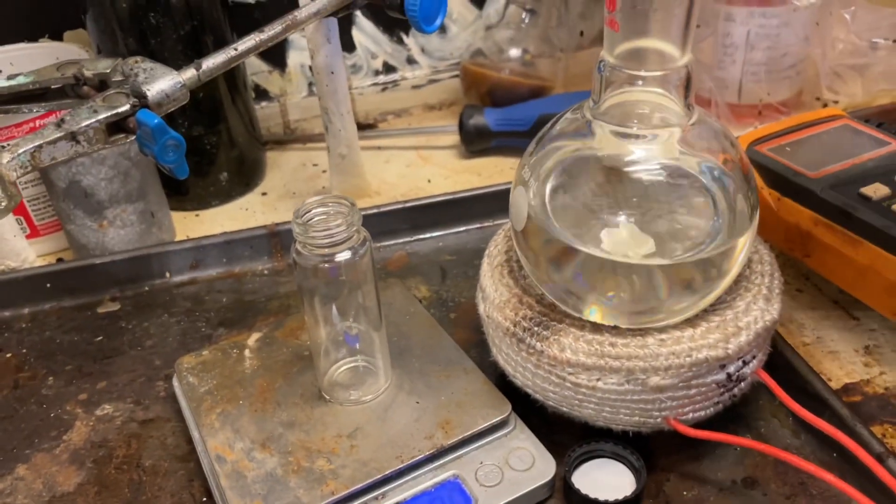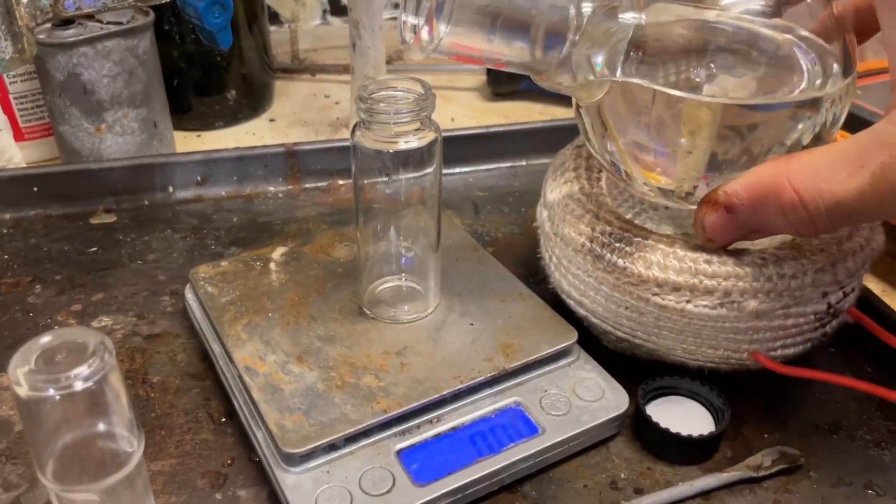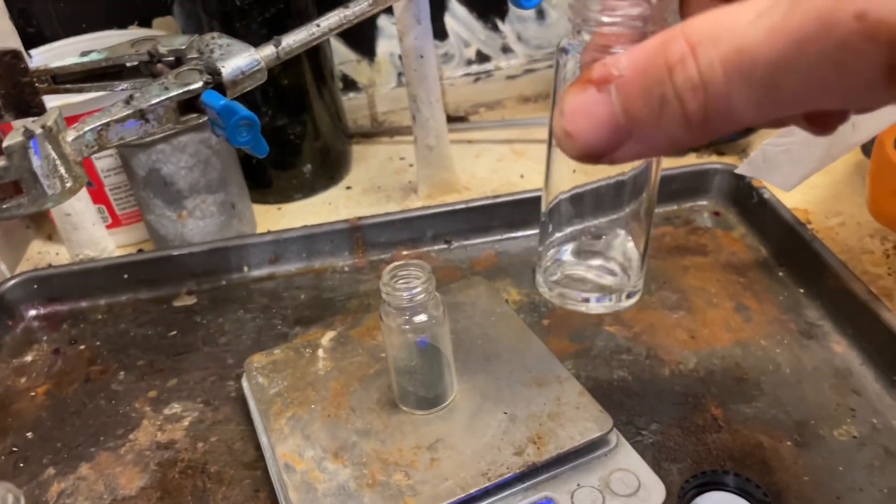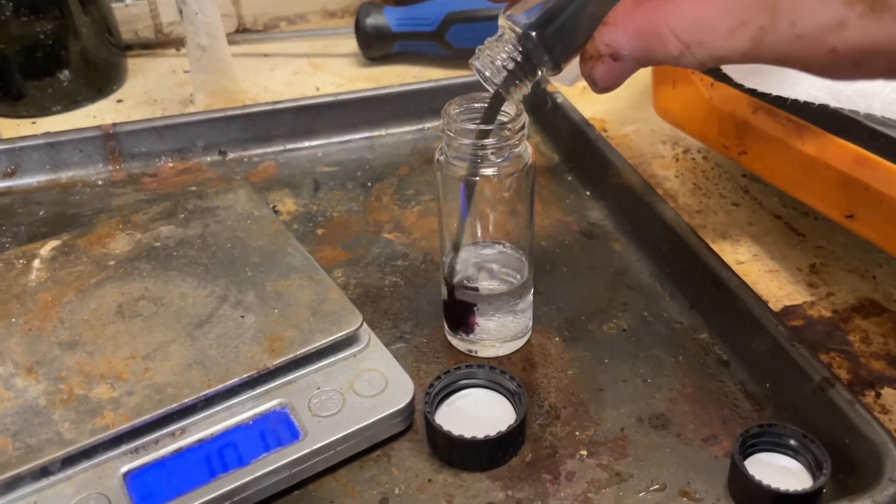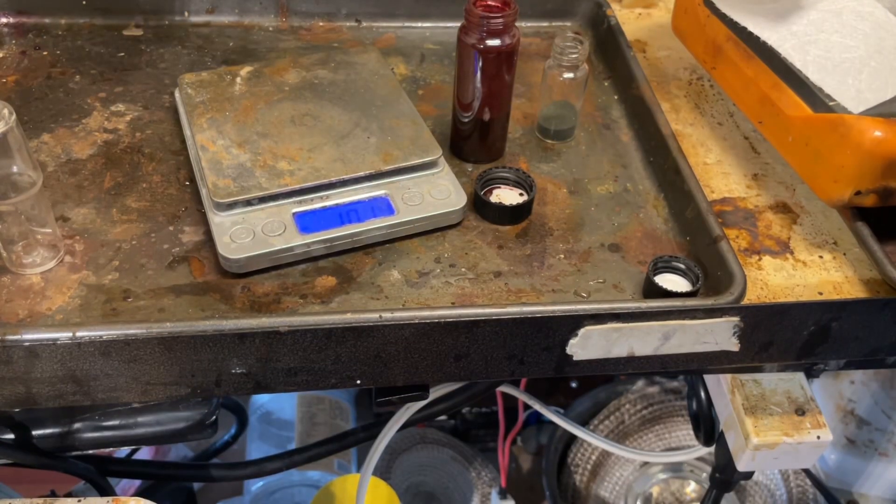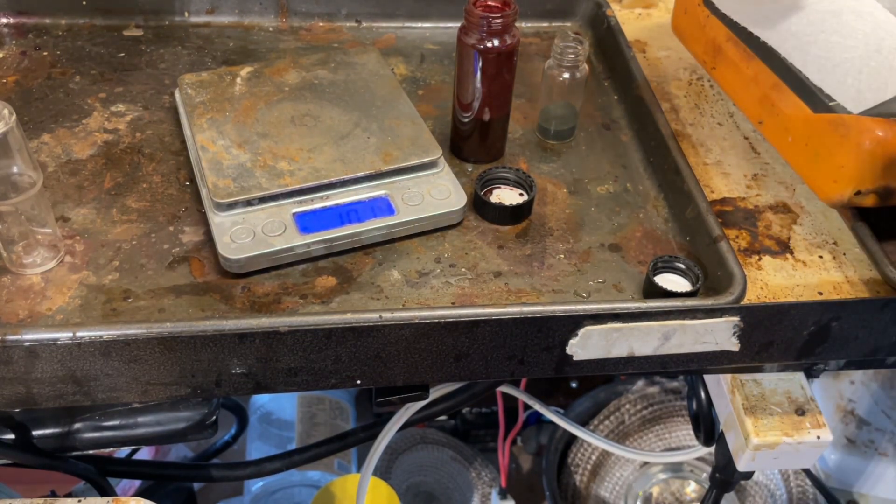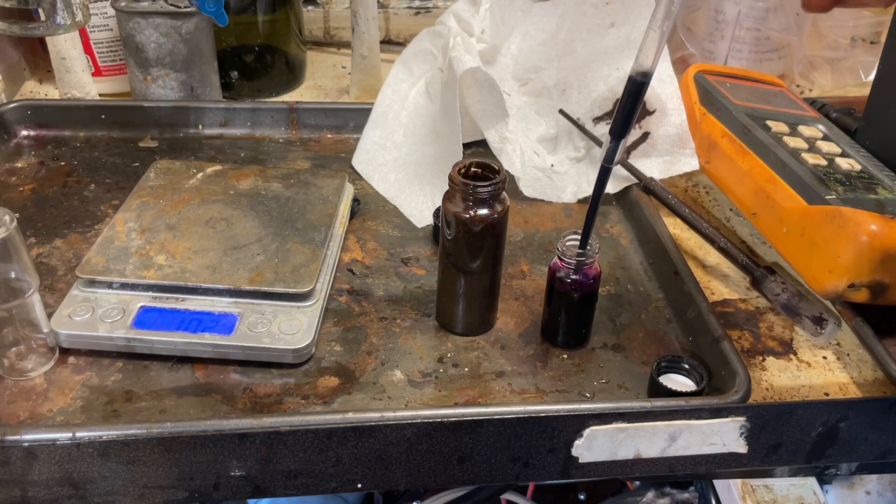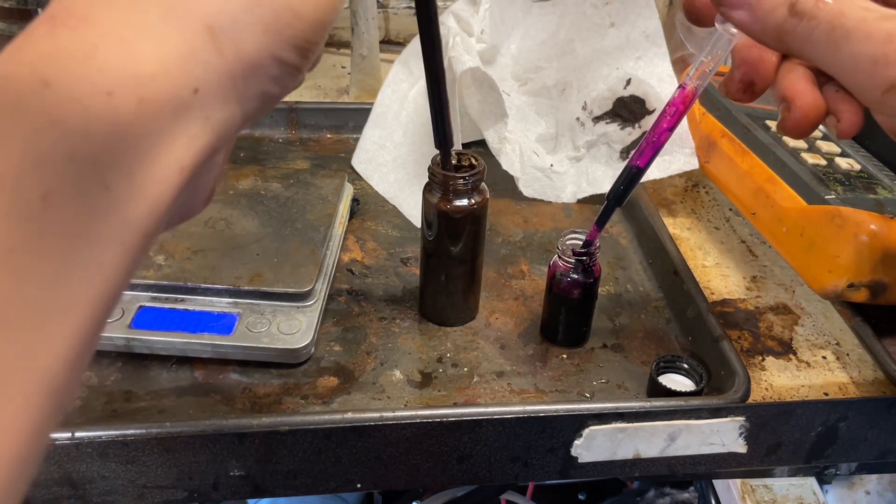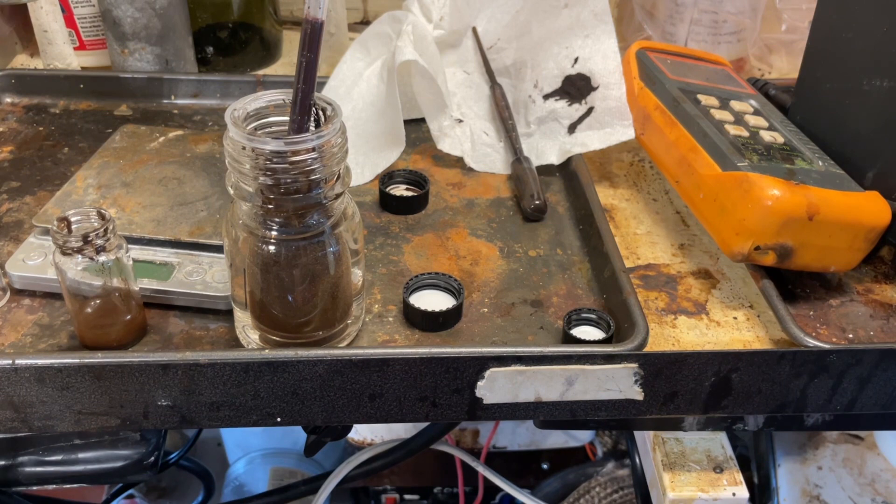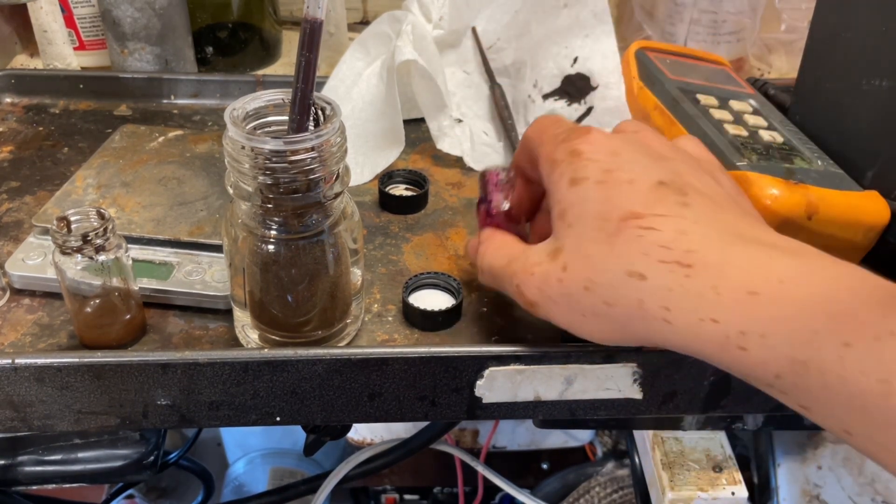Let's just try it scaled down. So, let me get some benzyl alcohol out. I'll use two grams of it. There we go. Potassium permanganate and benzyl alcohol. I'll add some water to this, and we can start addition. There we go. I'll add a little permanganate. Give it a good shake. Cap it and shake it, actually. I'll also add a drop of potassium bisulfate to act as an acid to help the reaction go along a bit faster. Okay, there we go. Dissolve it up, of course. Add some of this in. There we go. Cooled. Okay, so my phone storage ran out, so I quickly deleted 275 videos, though, so they'll never ever see the light of day. But, at least we can continue filming what's important, which is benzaldehyde.